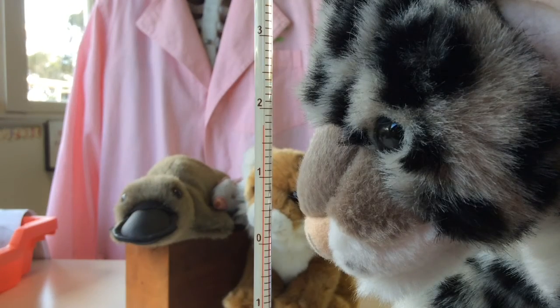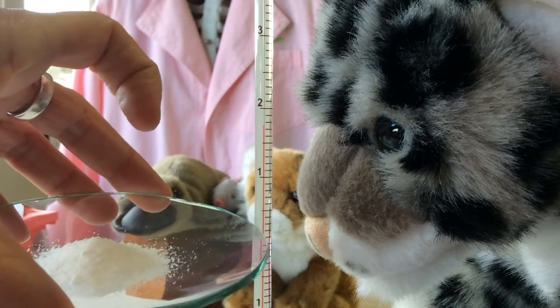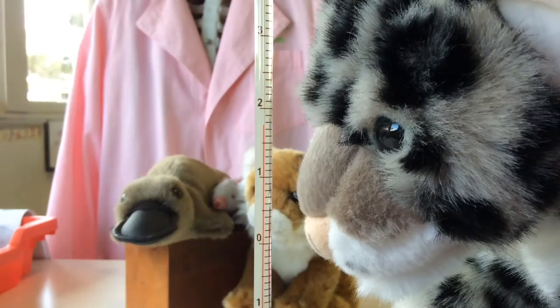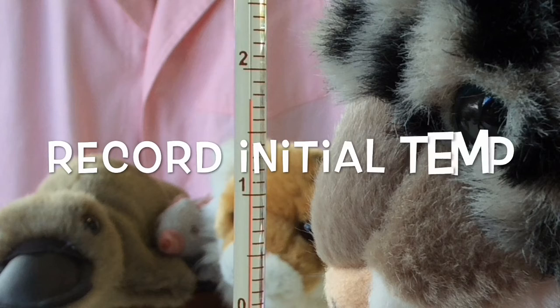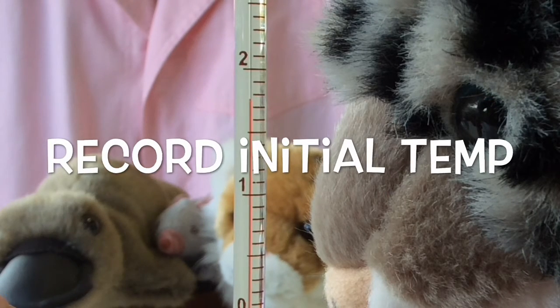Okay, I had to weigh out accurately about 3 grams of potassium nitrate. I've done that here. Okay, we can see the temperature. I'll probably zoom in a little bit more when we get going. Well, actually, I might as well do it now. Just to point out, this is 10, this is 0.